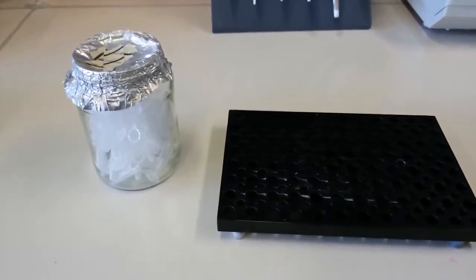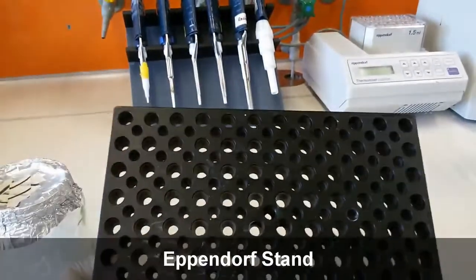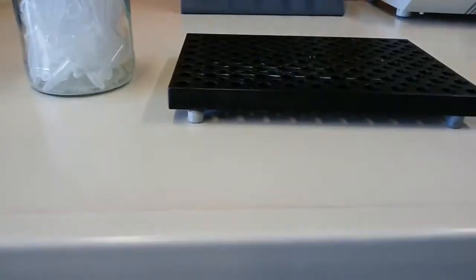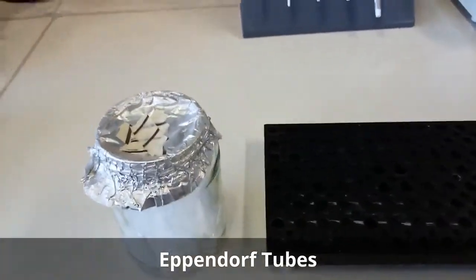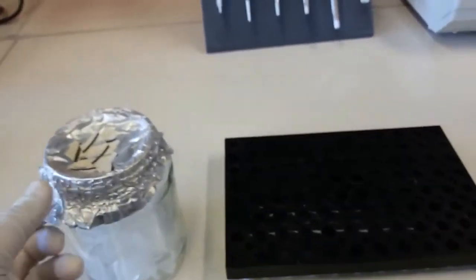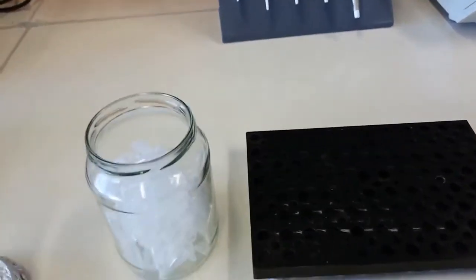Okay, so then probably this could be a very important lab utility. This thing here is an Eppendorf stand. This is just like a normal stand. You put them here, and in these holes you can put the Eppendorfs. Now you can see these are the Eppendorf tubes. We use them for a variety of purposes, and they can be of different volumes. Generally the most common and most popular Eppendorfs are of 1.5 ml.